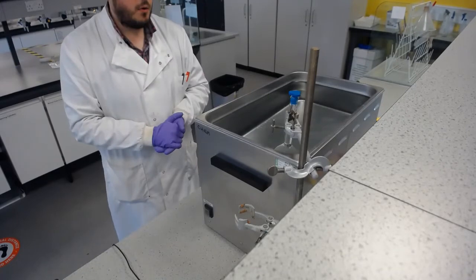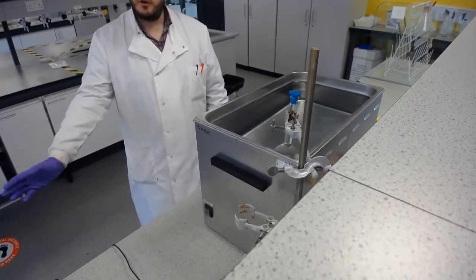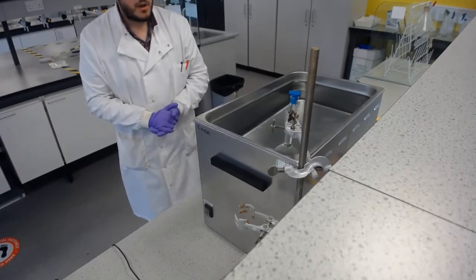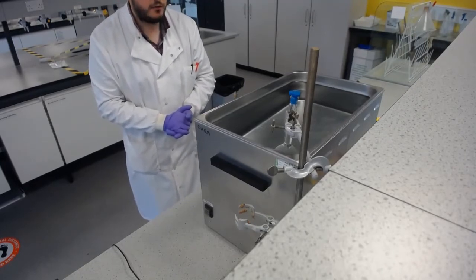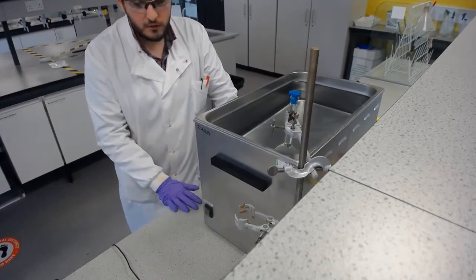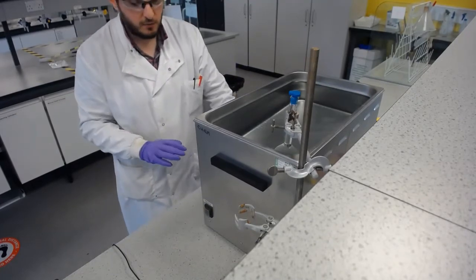Or as has been the case, and I've seen it in the past, we have some relatively nasty things that start flying everywhere because someone has heated it, forgotten it's heated, walked away, come back, touched it, caused a load of nucleation, and then the solvent's boiled over. And typically those people aren't wearing the protective clothes they need to wear, says a man speaking from seeing it. Okay, so all we do is just switch it on and let it go. I'm doing all the talking now because as I turn it on, it will be noisy. So I'll leave it on just for a second and then we'll move back to the fume hood. I'll turn the camera off and we'll move back to the fume hood once it's all dissolved.